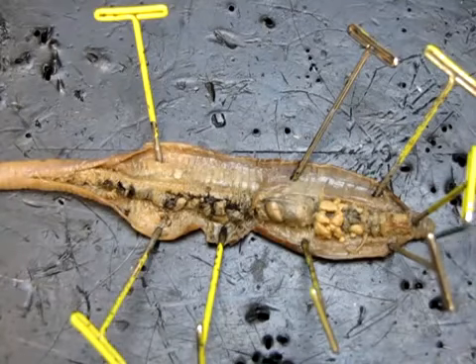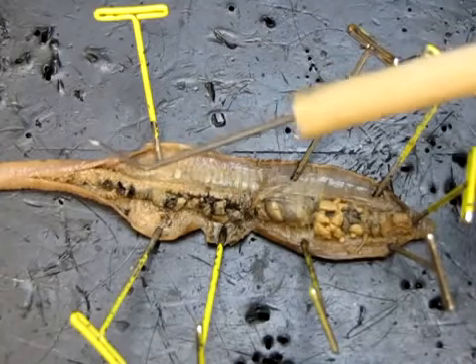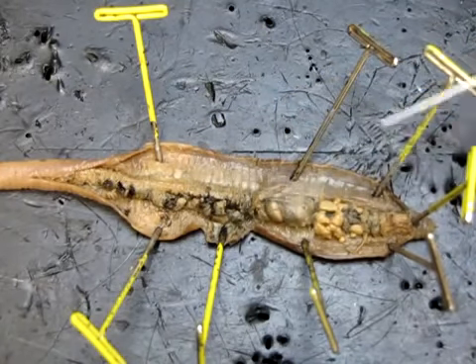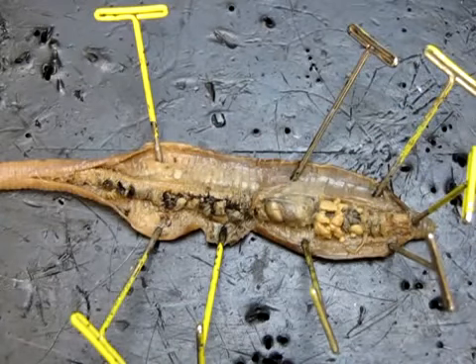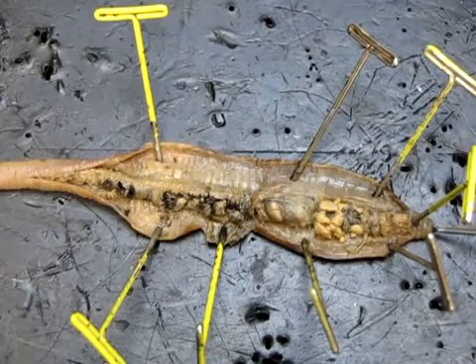So just to orient you again, we've got the anterior end of the animal here. The posterior is at the opposite end. Most of the business is happening anterior to the clitellum, which we saw earlier. So we're going to just focus at the anterior end of this animal. So the digestive system, of course, starts with the mouth. We've got the mouth down at the very tip of the anterior end down here.